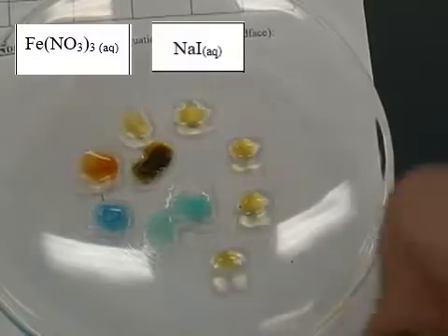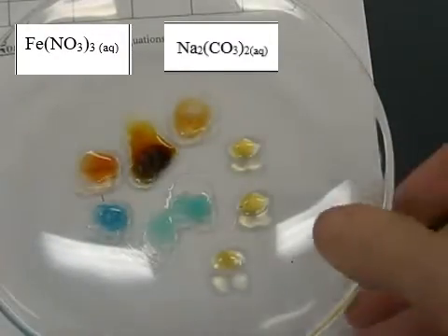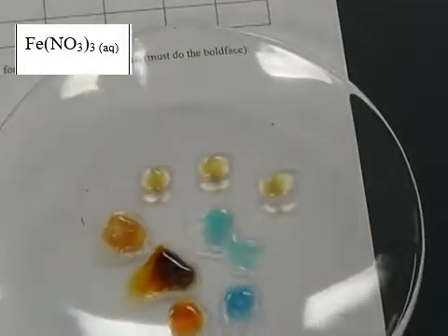Sodium iodide, there's like a deeper orange. Sodium carbonate. If you look close, again, you can see something formed inside there, nice and clear there, and that is sodium carbonate. So let's write those three down.